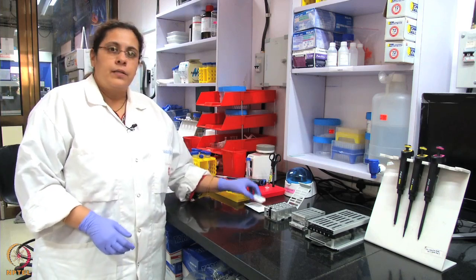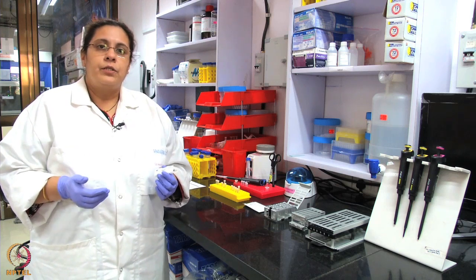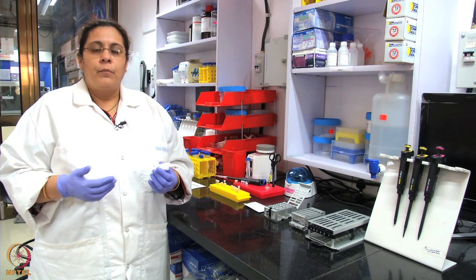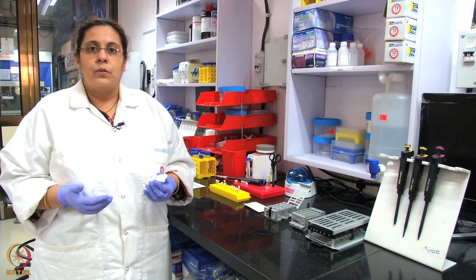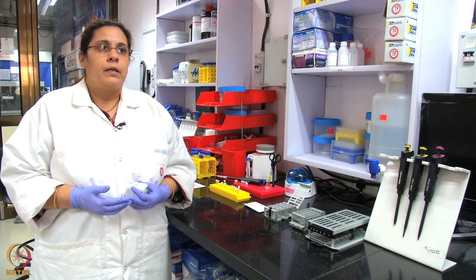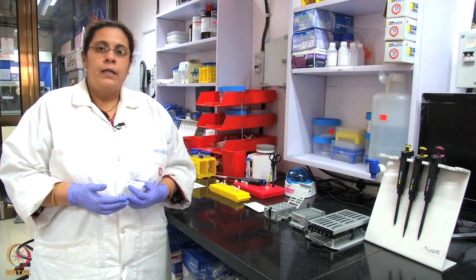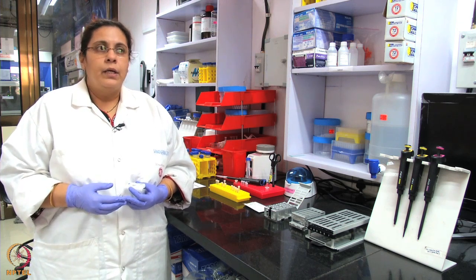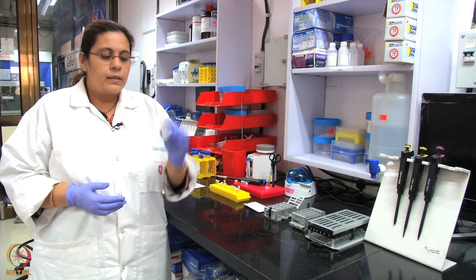Let me show you the sensor chip that we use for immobilizing the ligand. There are many types of sensor chips depending on what kind of molecule you want to immobilize and study. Typically for proteins there is a specific type of chip, and if you want to immobilize a lipid molecule like liposomes, there is a different kind. For today's experiment, we are studying beta-2 microglobulin antibody as the ligand and beta-2 microglobulin protein as the analyte. We are going to immobilize the anti-beta-2 microglobulin antibody on the sensor chip.